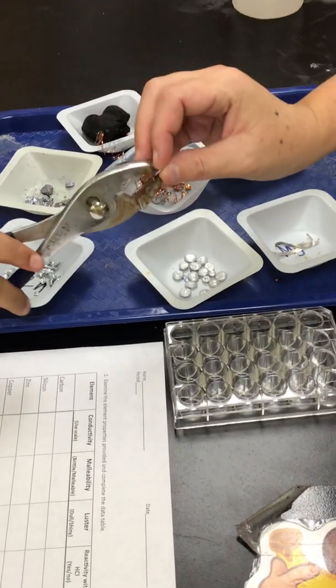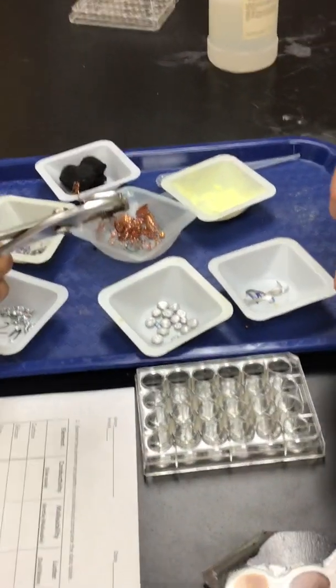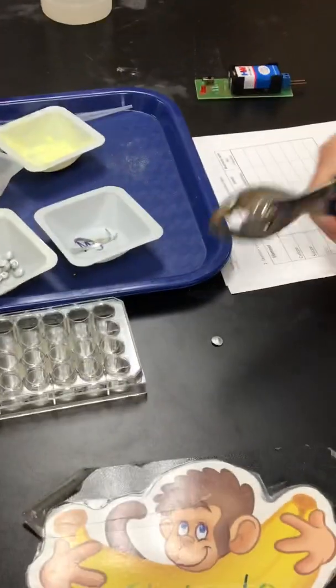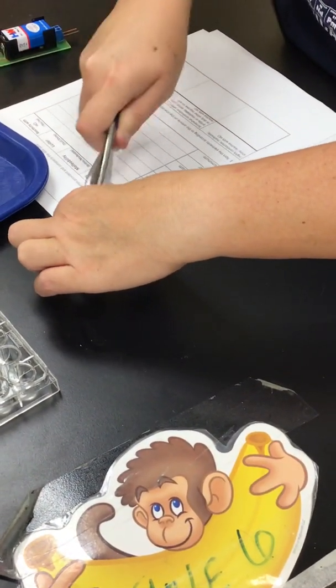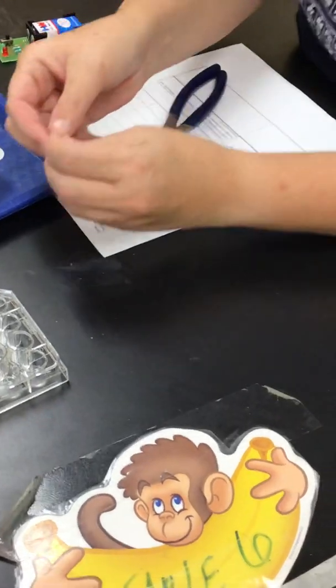Okay, squeeze really hard. Remember though, this is the same stuff they make aluminum foil out of. Exactly. So, and if we had a hammer, we can even do this. Let's try hammering it. Oops. Well, it's moving too much. It is flattening. That little bubble is going away. Okay. All right, so we finished malleable.